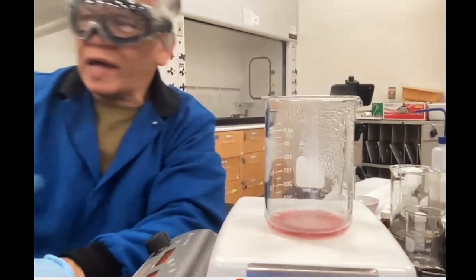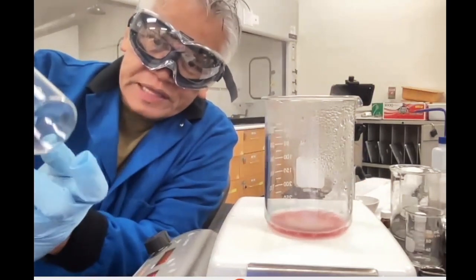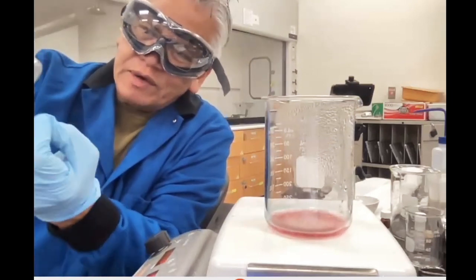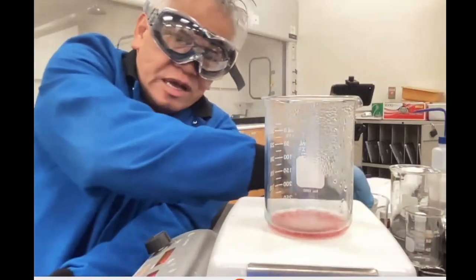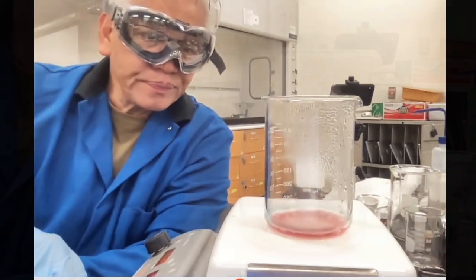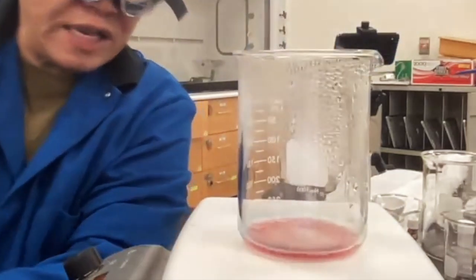You always want to inspect glassware by looking at the very bottom and look for stars. If there are stars, that's a stress on the glass. You heat it up, it'll break, because things tend to expand when you heat them. And when glass expands and there's a star or a stress, it just cracks. Okay, maybe I'll try using the electric stove. Maybe the small one, not the big one. Just put it on a low setting initially. Low setting. Okay, sure.